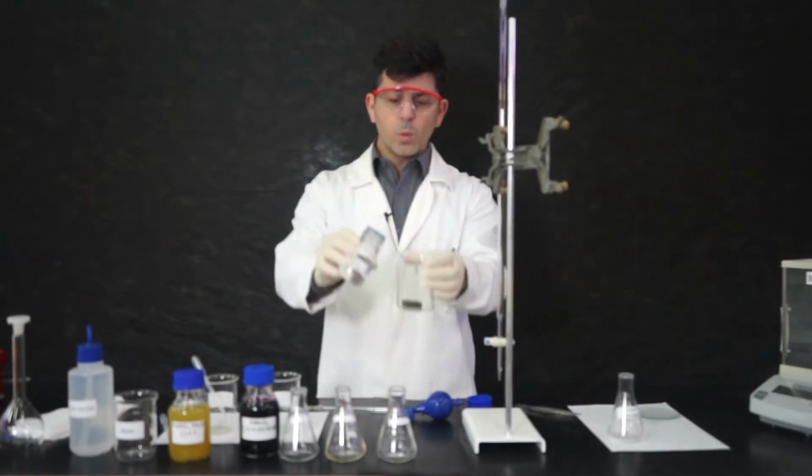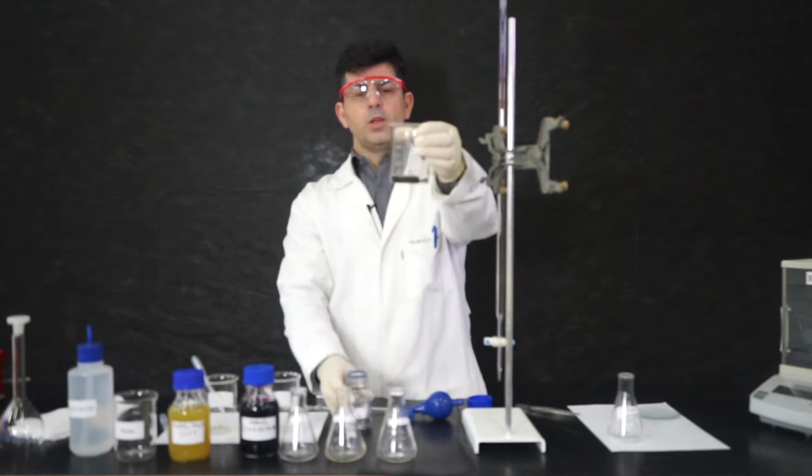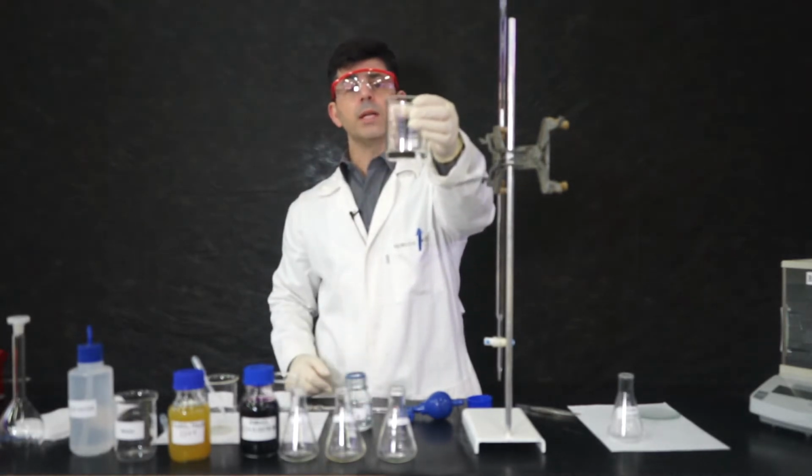Okay? So when we add sulfuric acid, you will see this will slowly react.